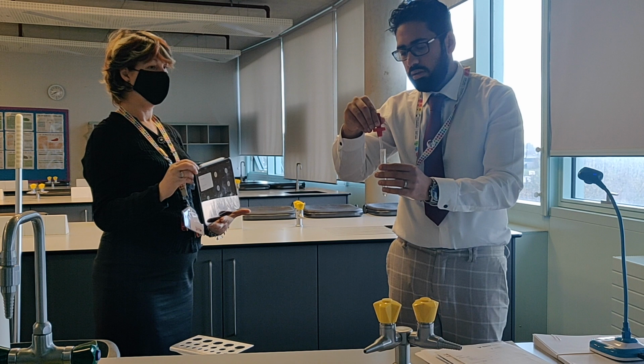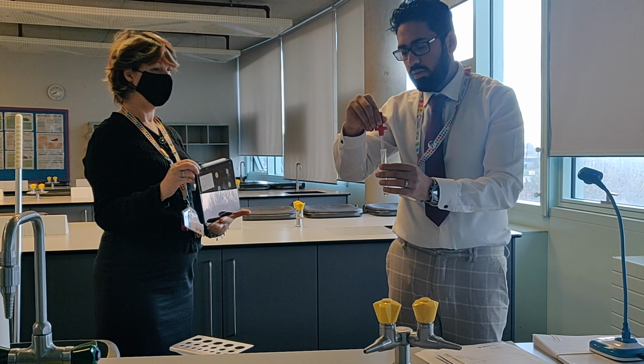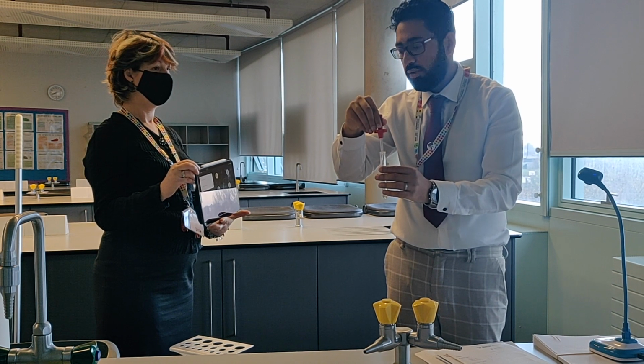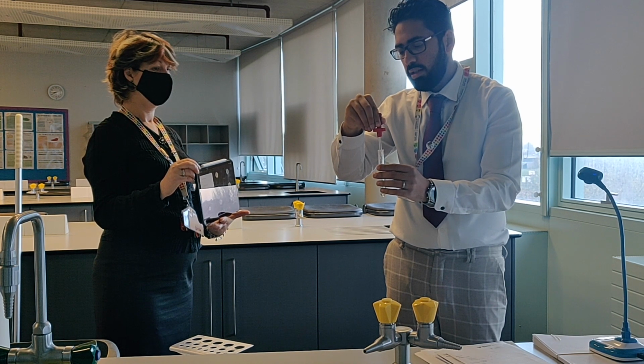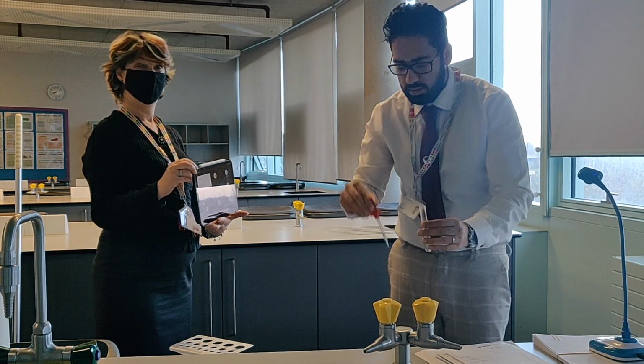Shall we check with them to see if they can see or? No, they should be able to see. 4, 5, 6, 7, 8, 9, 10. Okay.